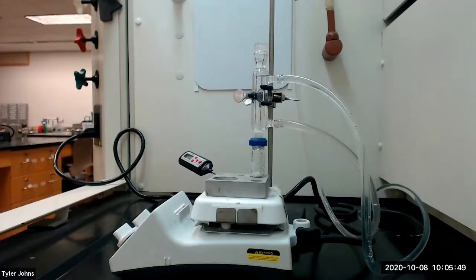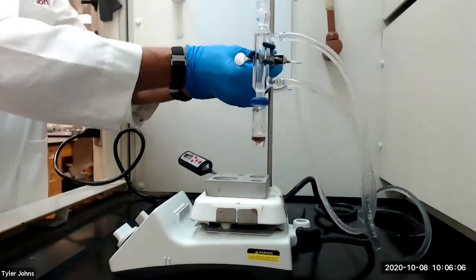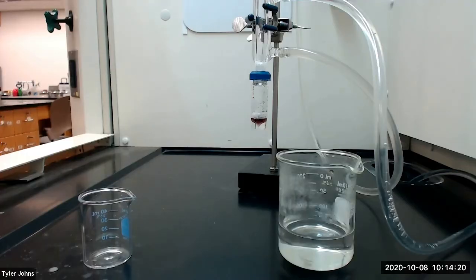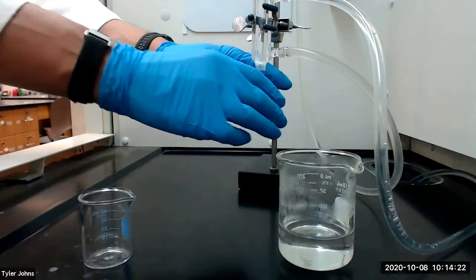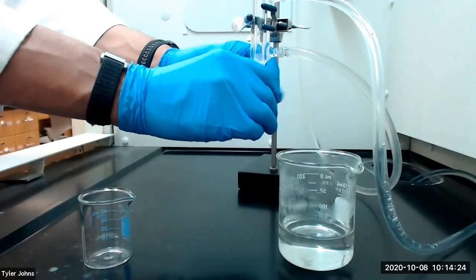Our reaction mixture has now heated for an additional 20 minutes after the solid had dissolved. So we will now remove the vial from the heat. After the vial has cooled to the touch, we're going to detach it from our water-cooled condenser.